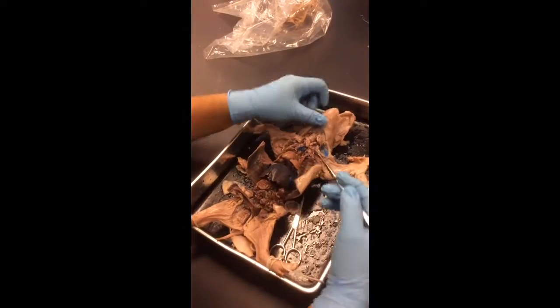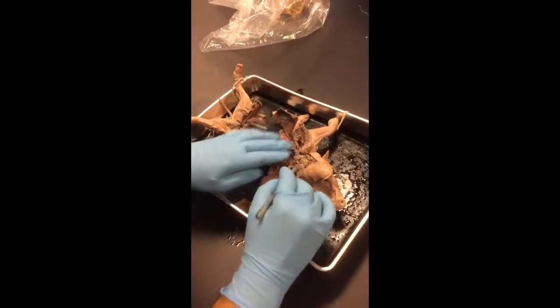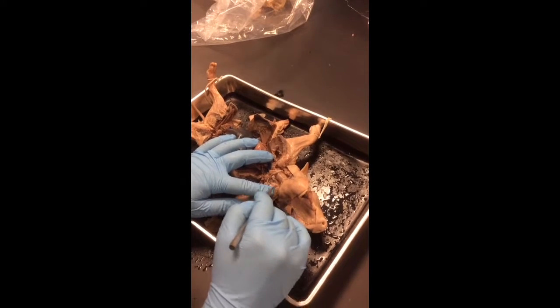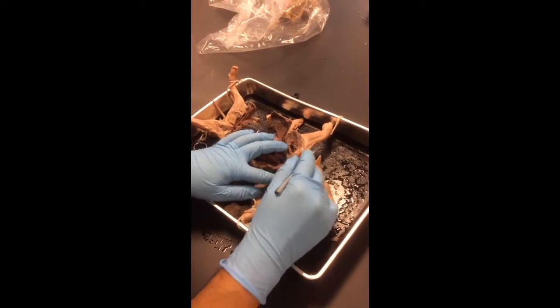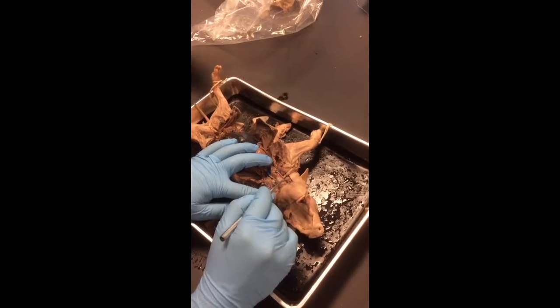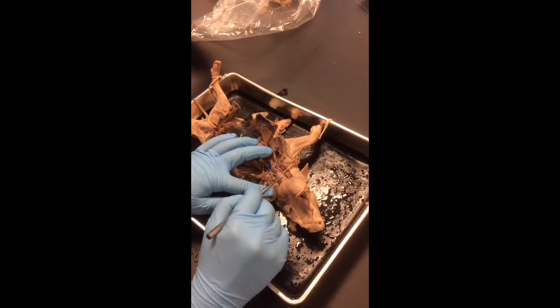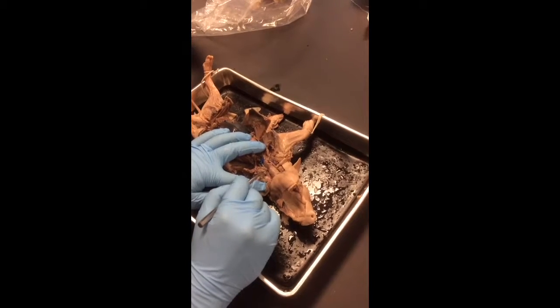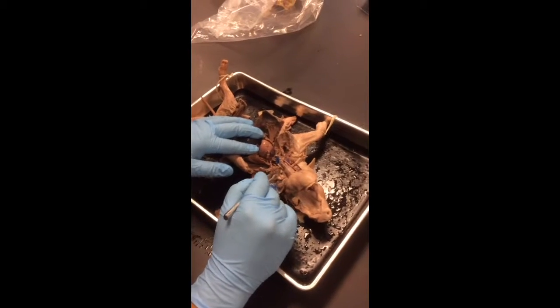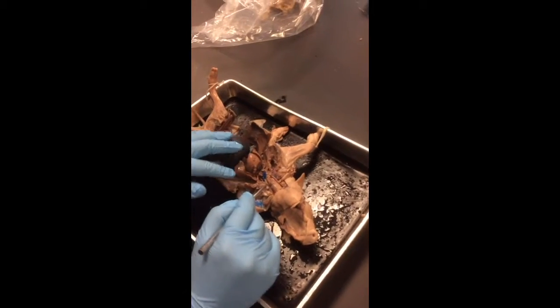Okay. Moving into the throat. Okay, so the larynx is the bulb at the top. That's not on the list, so you don't need to know it. But the cool thing about the larynx, it's a good structural marker. Here's actually the thymus gland. You don't need to know that. Below the larynx, and in front of the trachea is the thyroid gland right here, this brownish thing. That's the only gland we need to know. It's the only gland you're going to be responsible for.